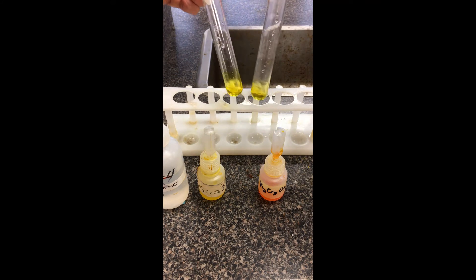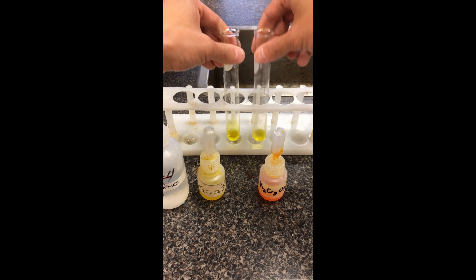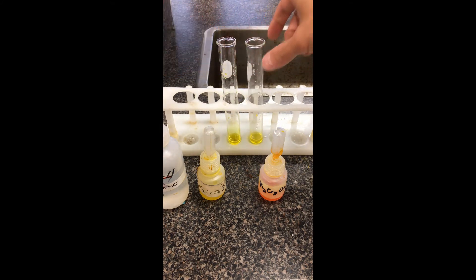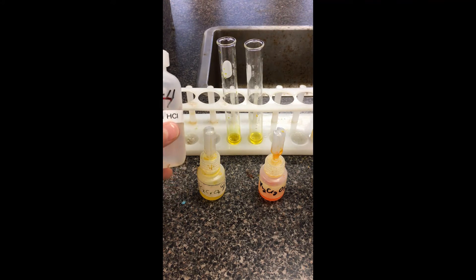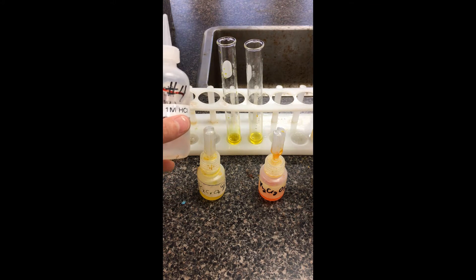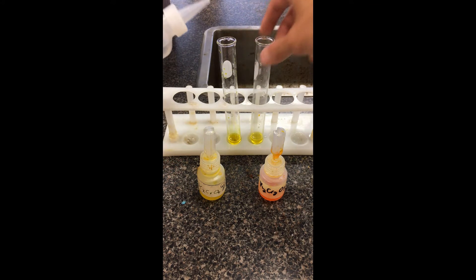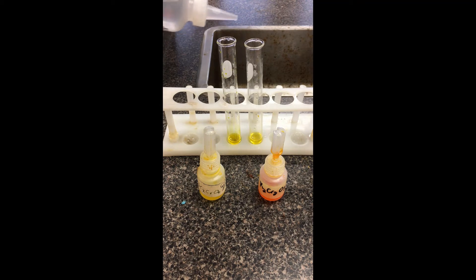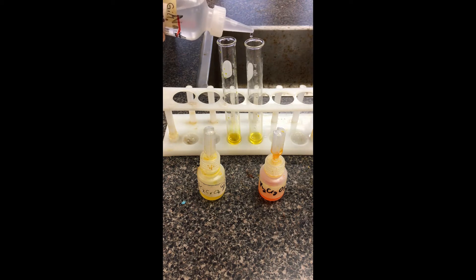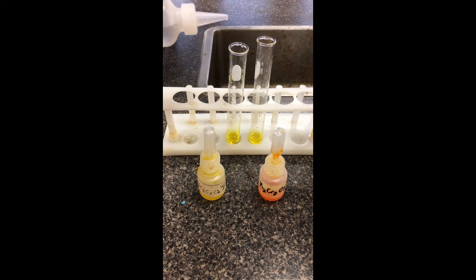The chromate solution here remained yellow. The dichromate has actually shifted over to the yellow color. This time I'm going to add the same molarity — one molar — but this will be acid. Again, adding it in alternation, one drop at a time.